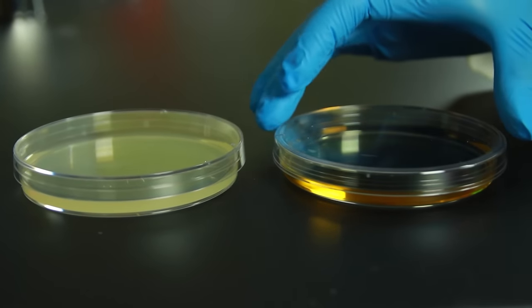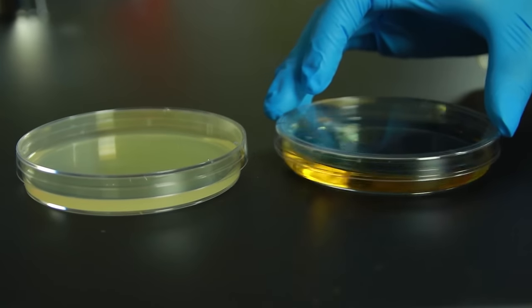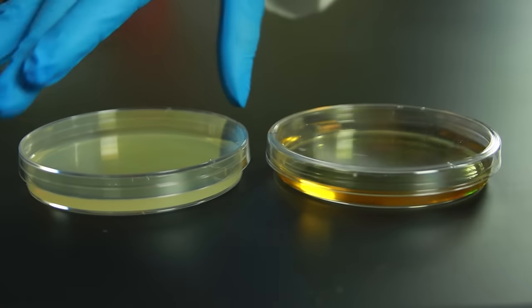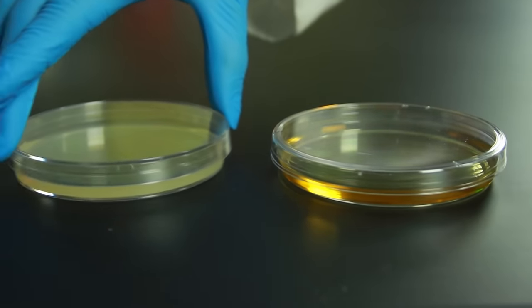Once the media has cooled, it will solidify and turn opaque. Here you can see the difference. The petri dish on the left has set up properly.